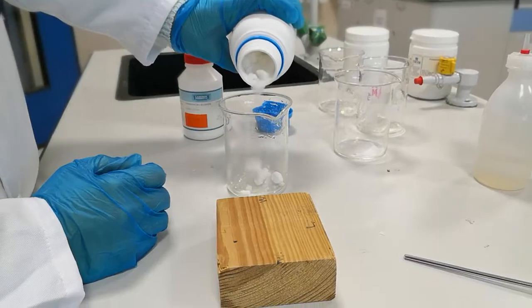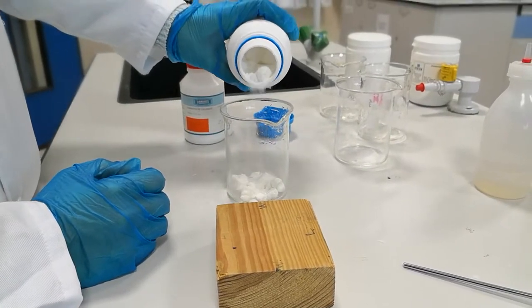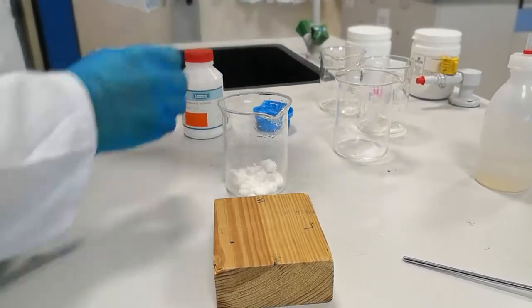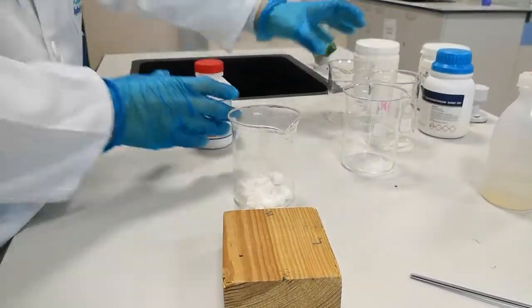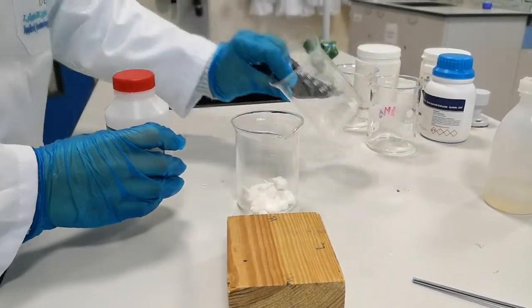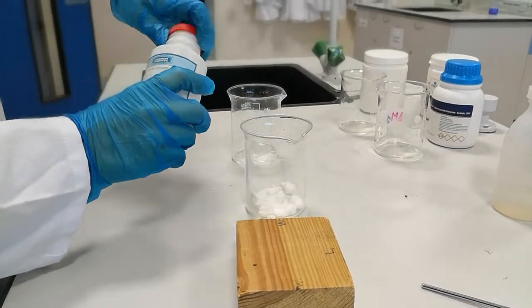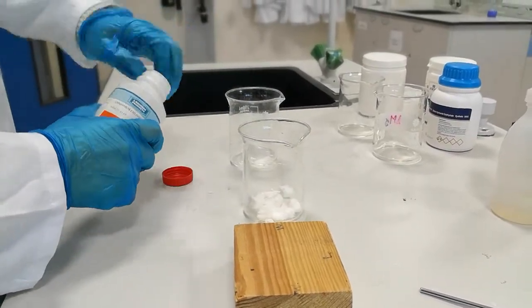So I am going to put some barium hydroxide in this beaker, and in another beaker I will add ammonium chloride.